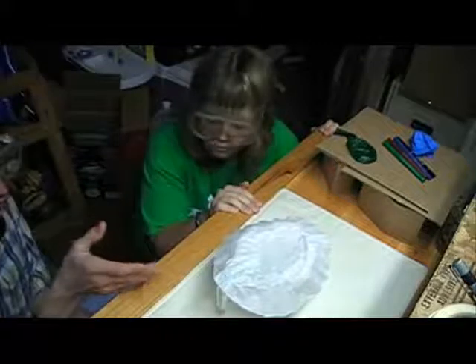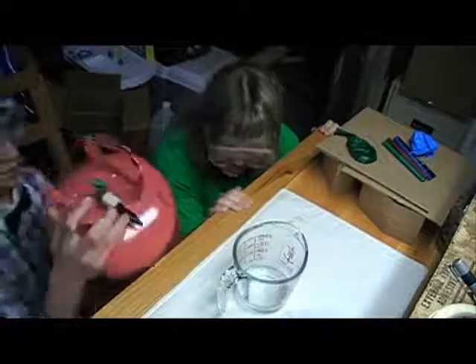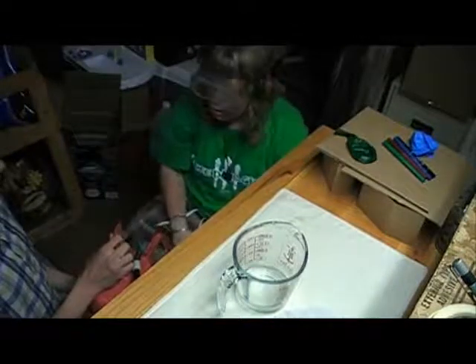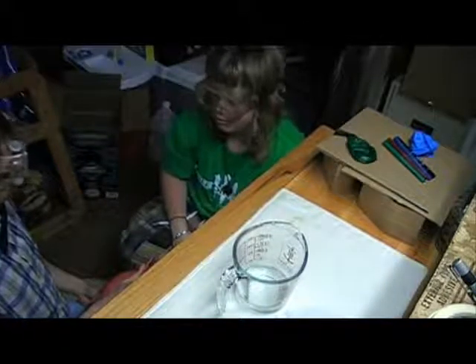Let's test to see if it reacts to helium. Wait. What? Helium doesn't react with anything. It's a happy, lazy, loner, noble gas. Does not react with other elements. It's not gonna react. Well, it reacts when I suck it in and it makes my voice all high. It's a little bit different. Let's just test that. Why not?